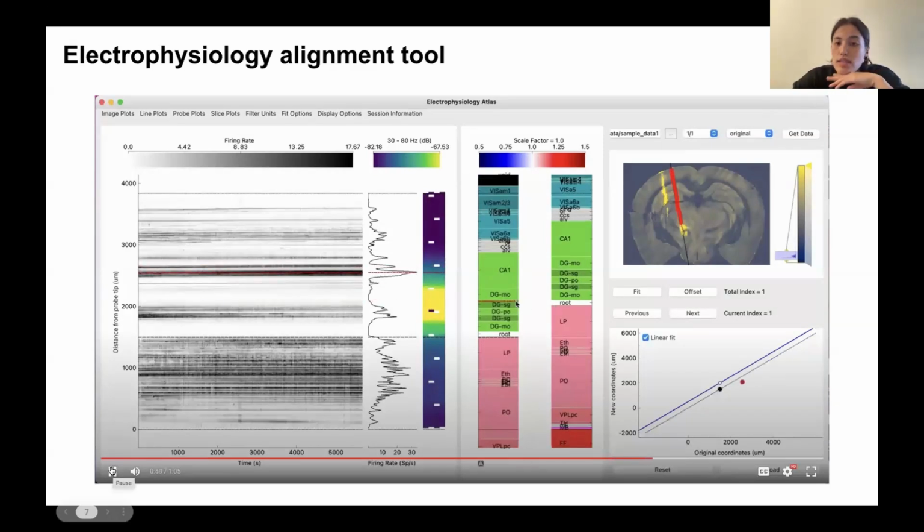So then I can continue this and add another reference line. In this case, I'm lining this high firing rate region here to the center of the CA1 layer in the hippocampus. And I add another reference line and then apply the fit. So in this case, we've not only applied an offset, but because we have two reference lines, we're also applying a scaling. You can see in the central panel here, this light blue area indicates a scaling factor that you applied to the different regions.